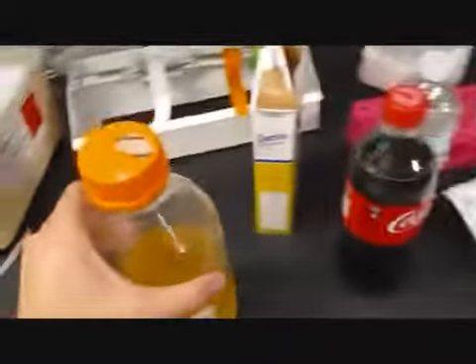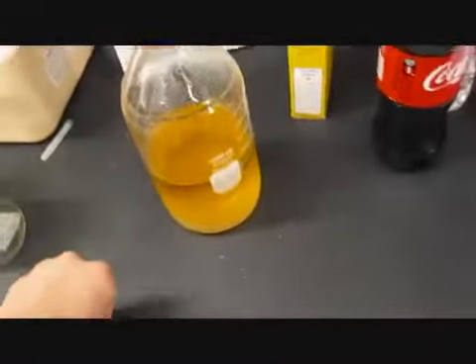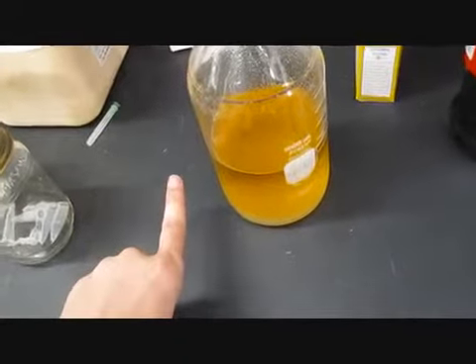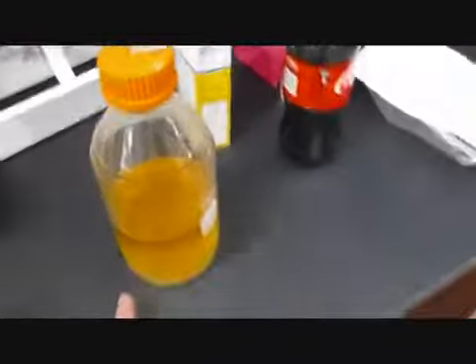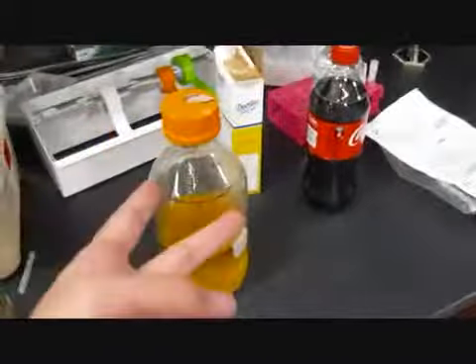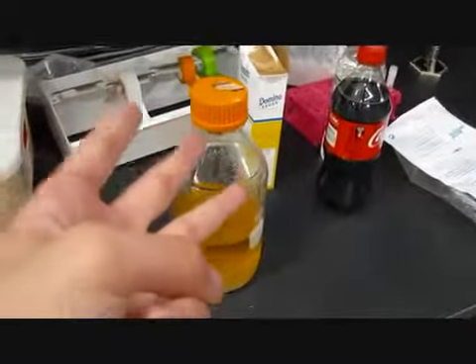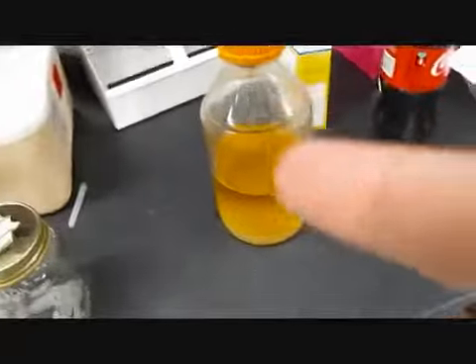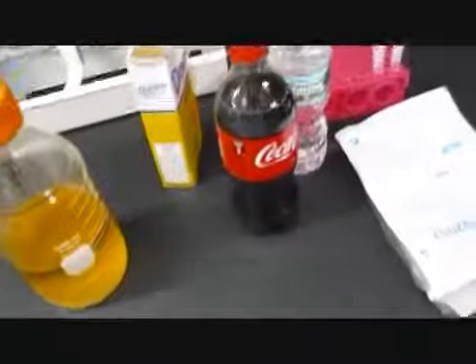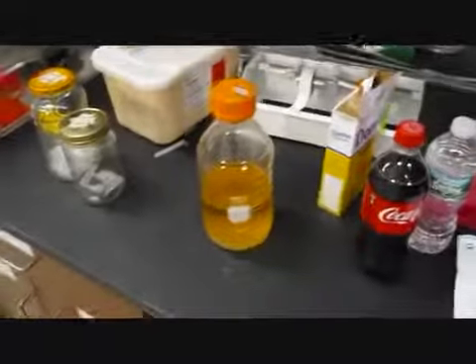And tomorrow, like I said, we're gonna autoclave this stuff and then make it into plates, and we're gonna have 6 plates total. We're gonna have H2O, H2O sugar, H2O HCl, H2O sugar HCl, Coke, and the control listeria that's in BHI and fridged overnight, so there's not a lot of growth. And that's it so far. See you tomorrow.